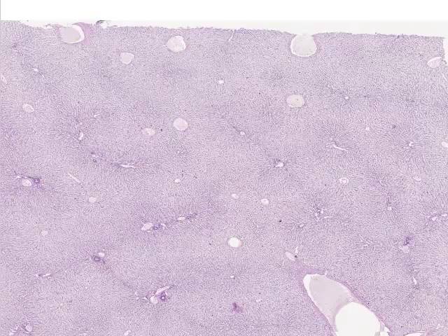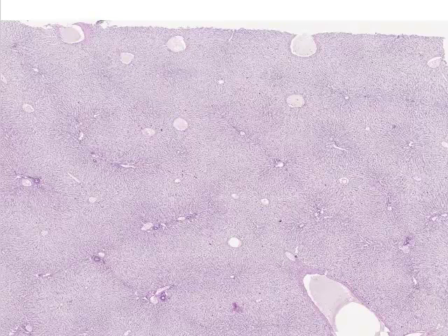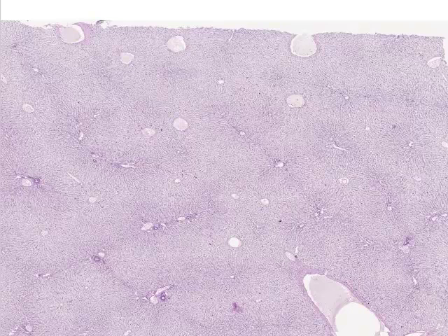Let's take a quick look at the overall histological structure of the liver and then we'll zoom in and take a look at the structure of some of the features which you would be required to know and to recognize. A few things to get straight about the liver before we begin. The first is that it's a massive organ in comparison to the size of sections which can be made for histological examination.